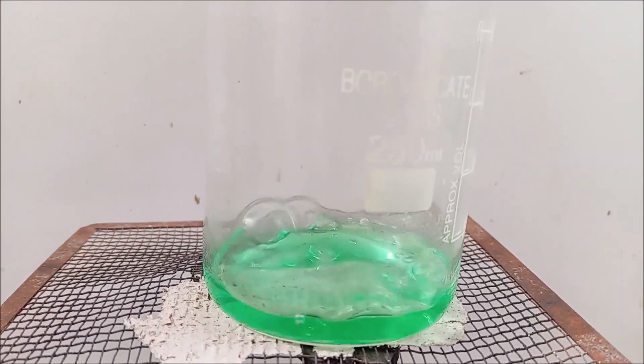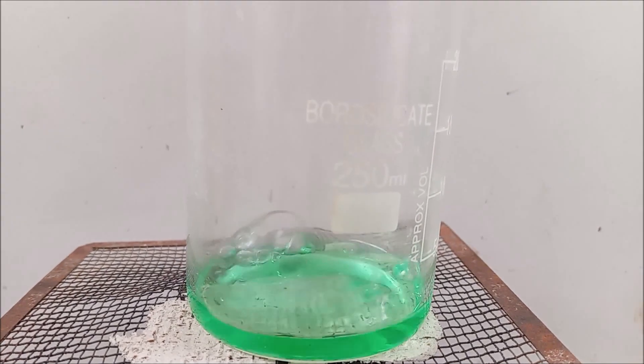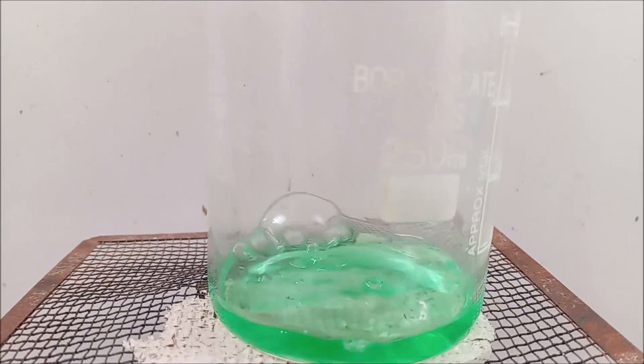Now heat the solution for about 3 minutes. As you can see the color lightens a bit. Still, it is green in color.